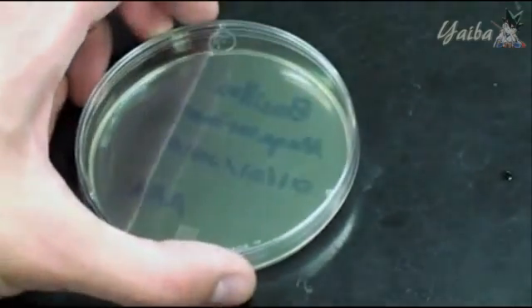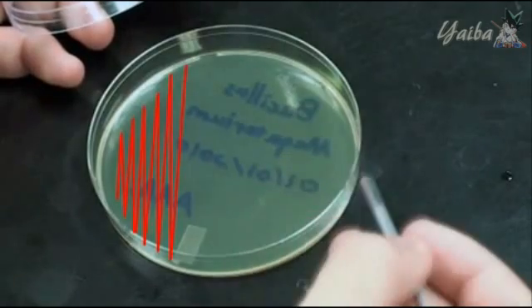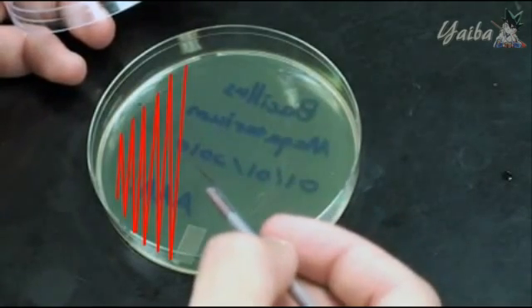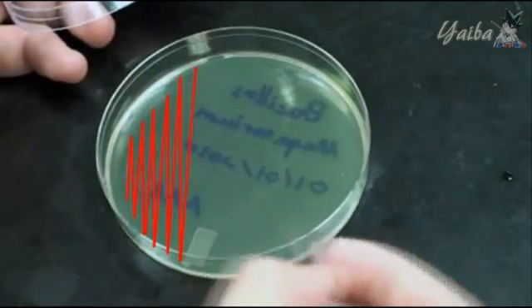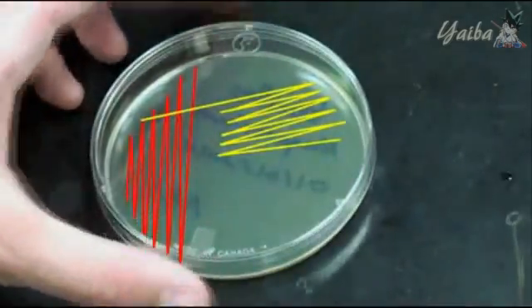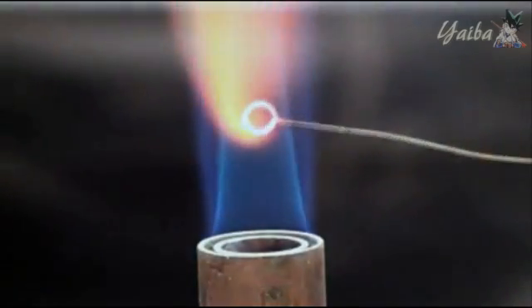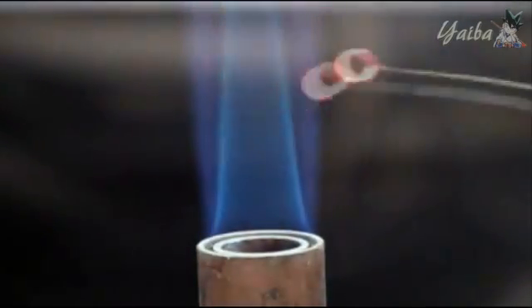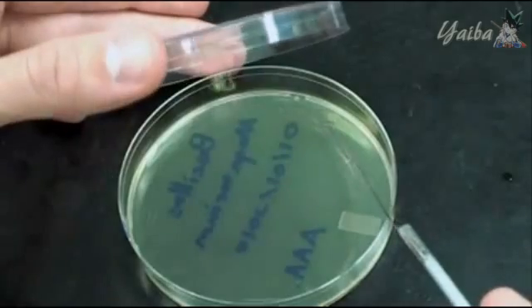Instead, you will use the sterile loop to effectively drag bacteria from the area just streaked into an adjacent 1/3 of the agar's surface, spreading out the cells. Be sure to only pull the loop across the first third once, making the rest of the strokes in the second third only. Finally, drag cells from the second third into the final third, spreading them into the remaining space on the plate.